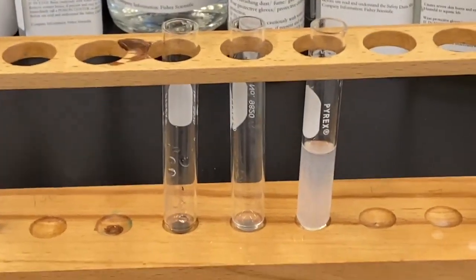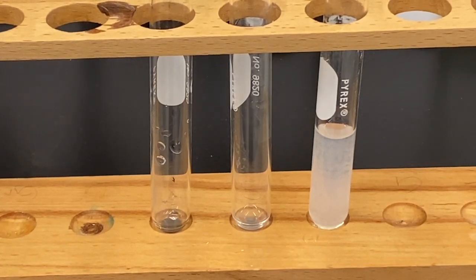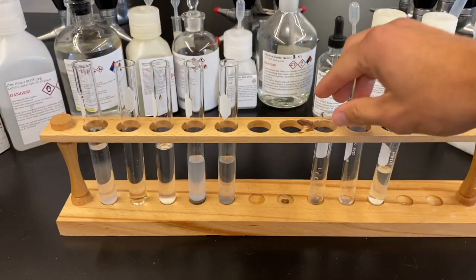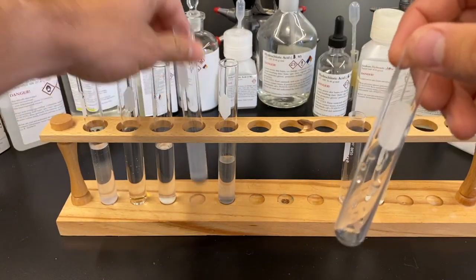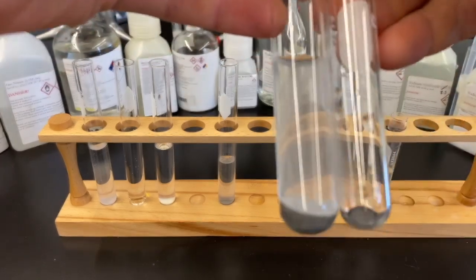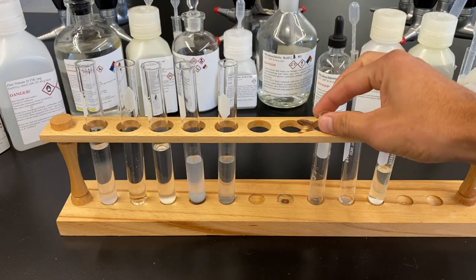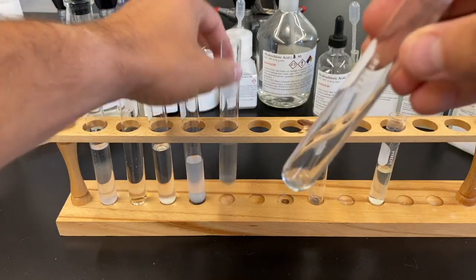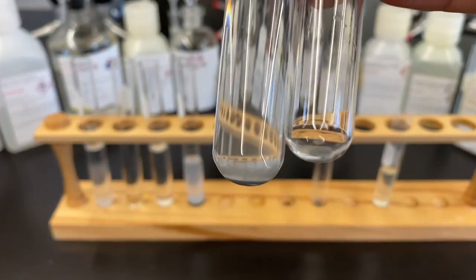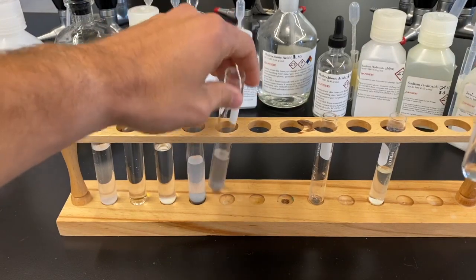Do a quick comparison of these unknown ions to the knowns that we determined. Here was that black precipitate that formed on the far left side of the reaction table. And it's kind of hard to see because the smaller test tube's been centrifuged down to a pellet. Same with this one as well. A little difficult to see, but a little grayish precipitate on the right side of that reaction tree that formed.